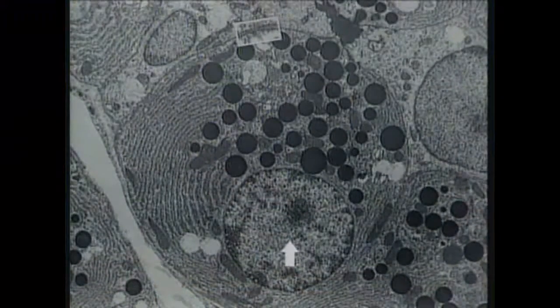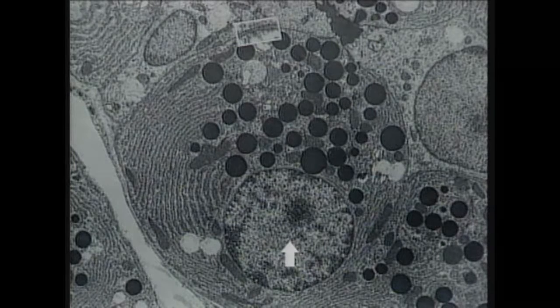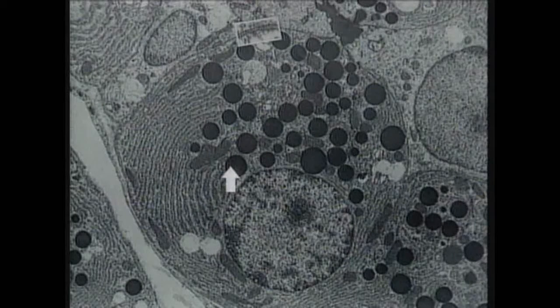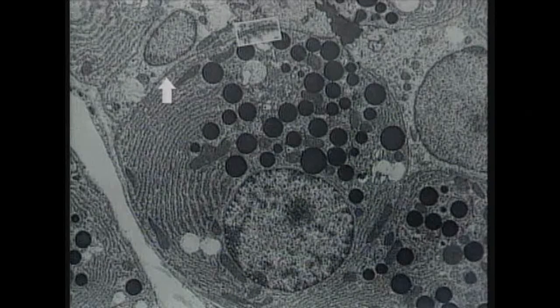This image is an electron micrograph of a pancreatic acinar cell, which is a cell involved with very rapid rates of protein synthesis and secretion. This image comes from figure 1-2 in your visual histology textbook, and the arrow right now is in the nucleus. The nucleolus is here, the rough endoplasmic reticulum is here, secretory vesicles are here, this is a mitochondrion right here, and in particular I want to call your attention to the cell membrane out here.